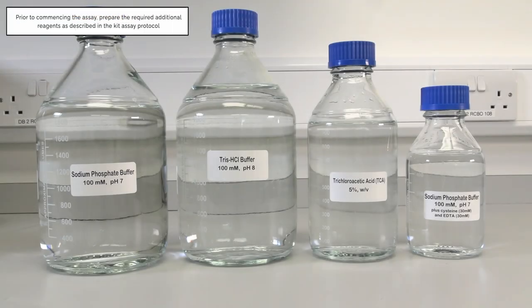Prior to commencing the assay, prepare the required additional reagents as described in the kit assay protocol.